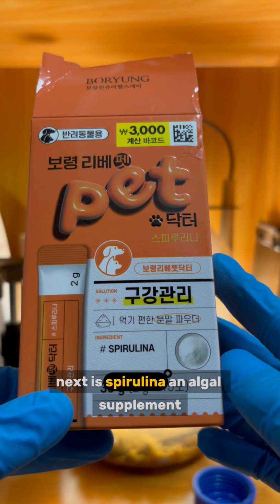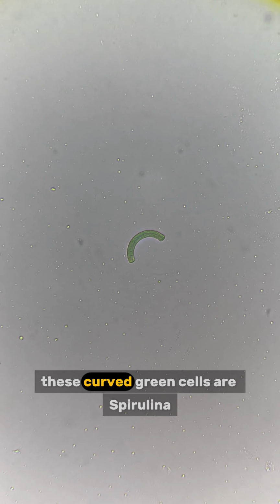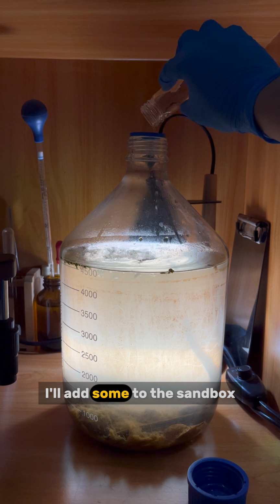Next is spirulina, an algal supplement. Let's dissolve it and observe it under the microscope. These curved green cells are spirulina. The concentration is lower than expected. I'll add some to the sandbox.